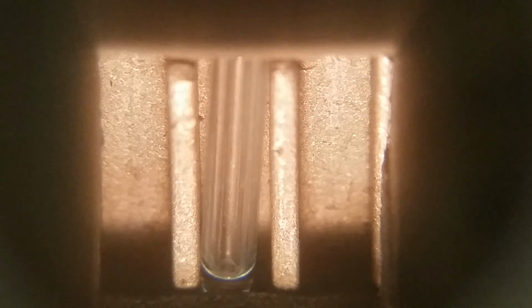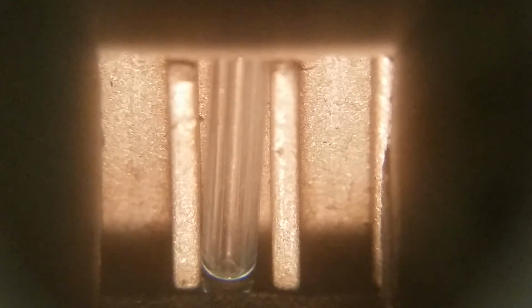So that puts it at about 107? 107? Alright, 107.